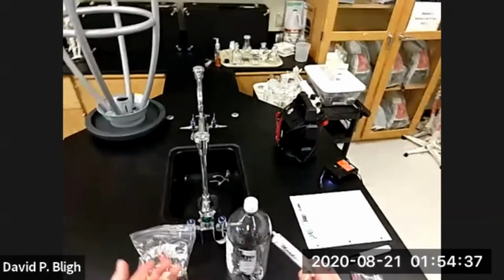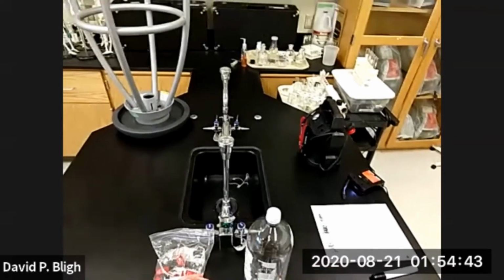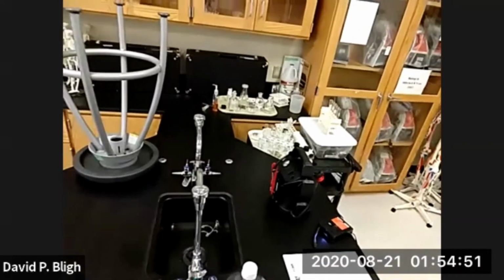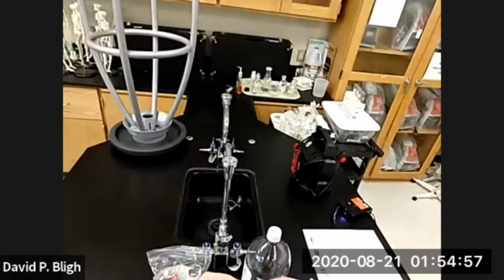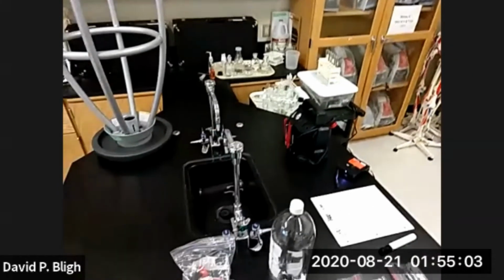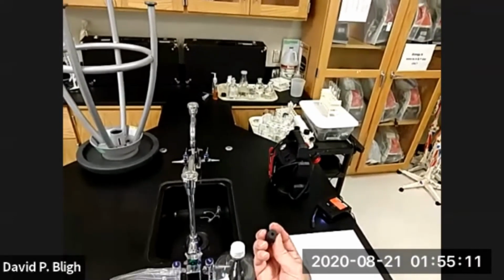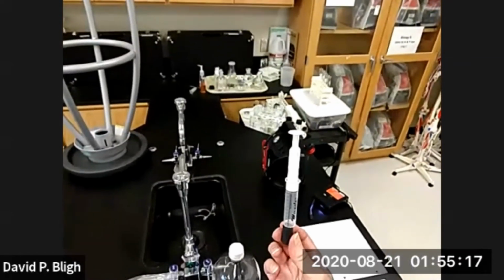Okay, so in order to start the experiment, we start from a volume. And normally what you would do is set it at 10 milliliters. But what happens is, when the pressure is finally released completely, the volume is less than 10 milliliters. So we could go a little bit higher. Don't want to go too far, because for the last measurement we don't want it beyond 10, then we can't read it. So we'll set it there. And how do we trap the gas? Well, I use a cork that's been bored only a little bit on one side. Now, there's our trapped gas.